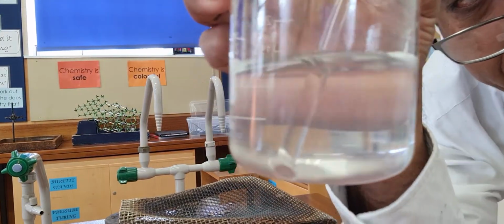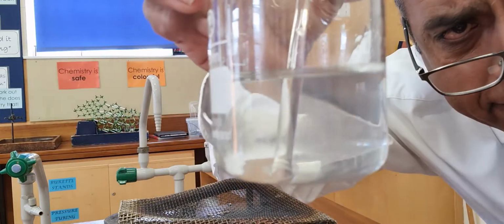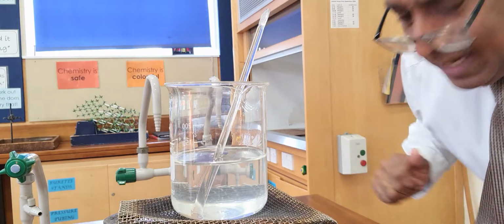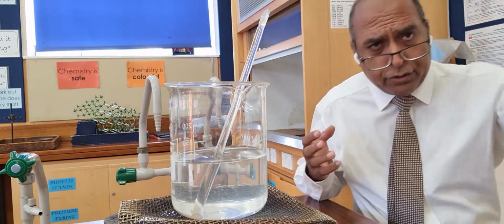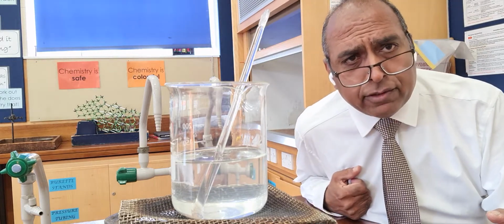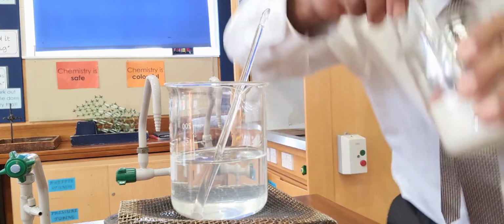But I want you to see, perhaps if I lift it up, the important thing I'm trying to teach you: if the solution is transparent, then there are no solid bits in the way to stop the light. And that's how we know something's dissolved. The solution is transparent. Now watch again.